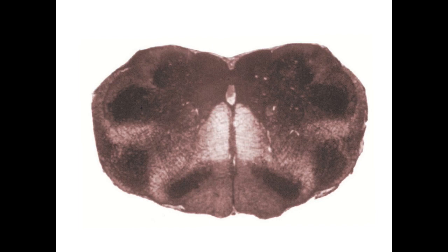Here we have a central canal, as you see, and no H-shaped gray matter, so it is closed medulla. Look at the gray matter. Here you cannot see the picture of a butterfly or two birds, but instead we have here anteriorly the full pyramids. And on each pyramid, you will have the medial accessory olivary nucleus, which is a gray matter, so it is dark compared to the pyramidal tract. Here they look as if you have a mustache. So this is the closed medulla sensory decussation.